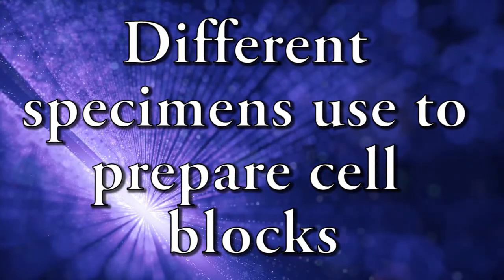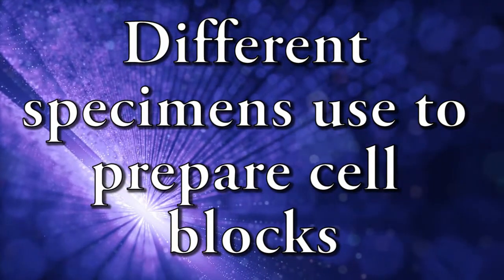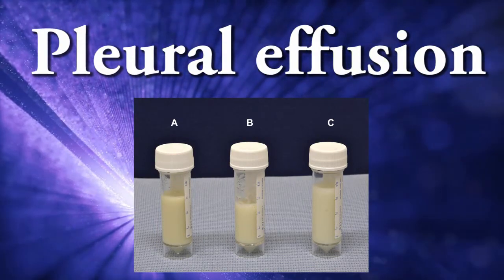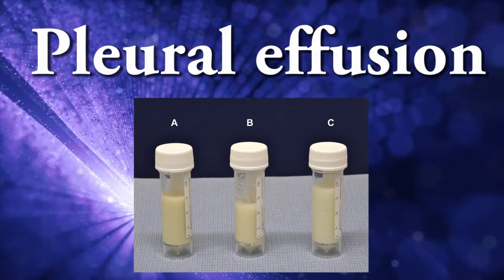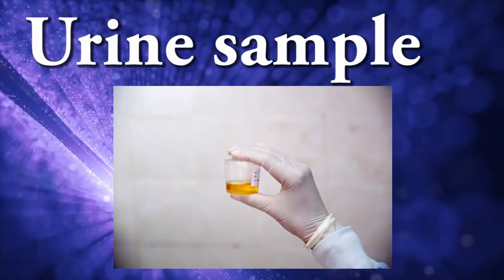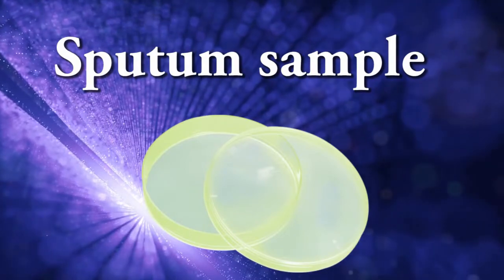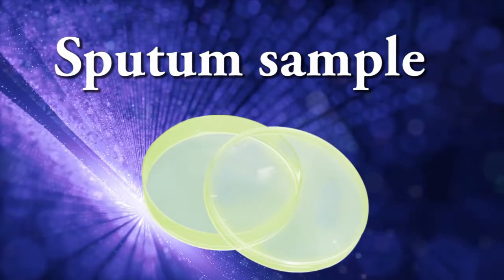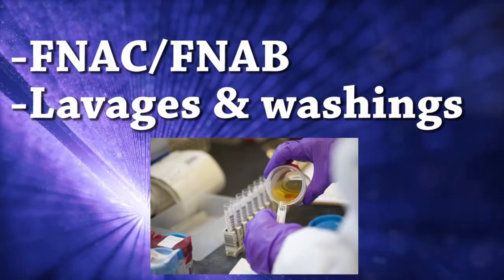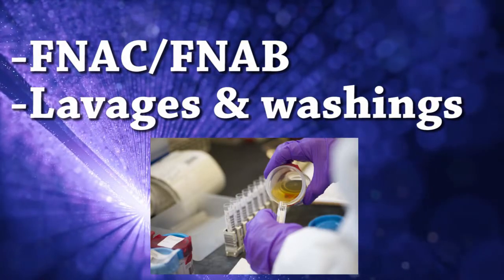Different specimens are used to prepare cell blocks, including urine samples, sputum, and fine needle aspiration cytology.